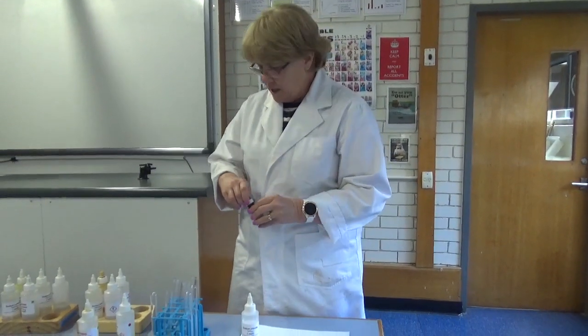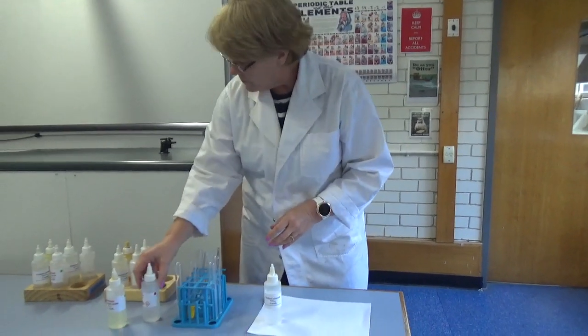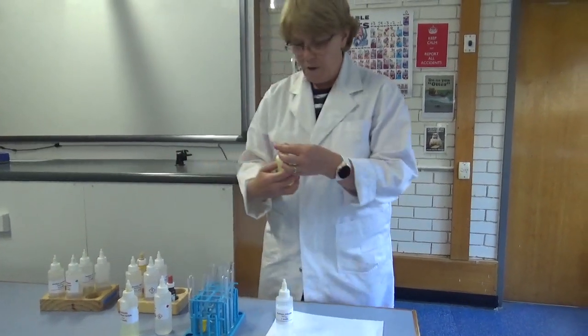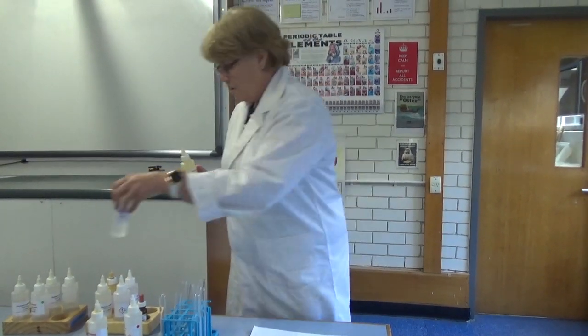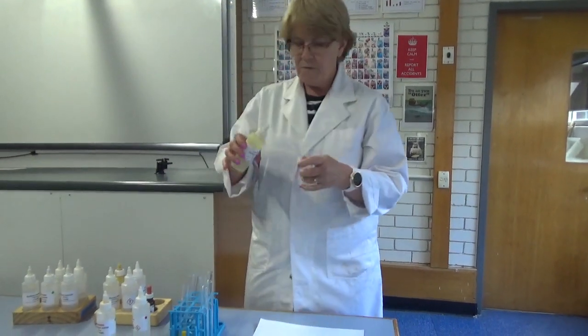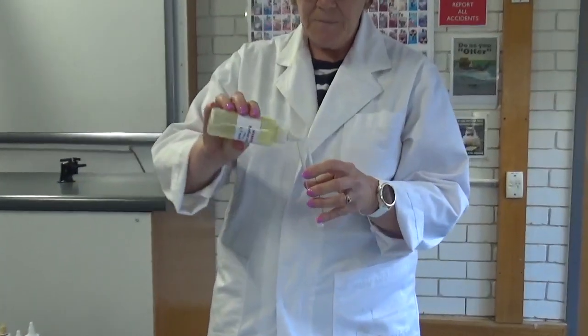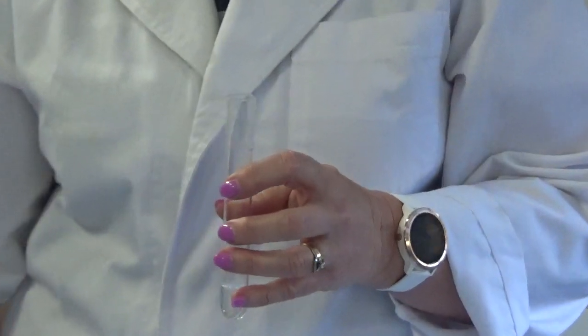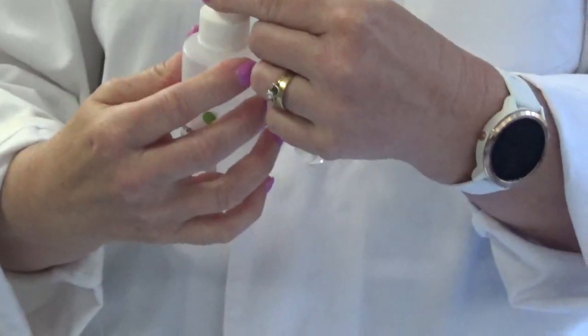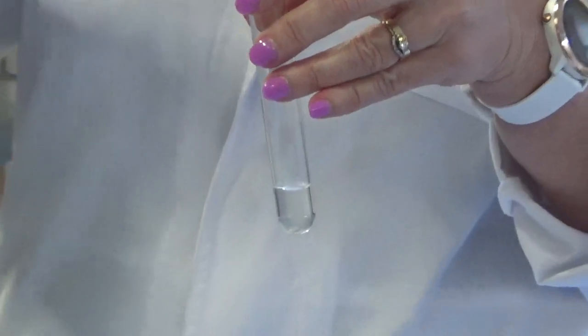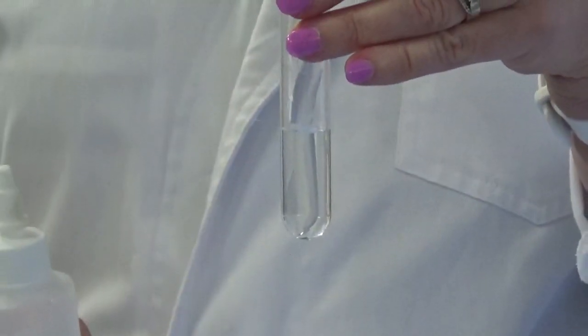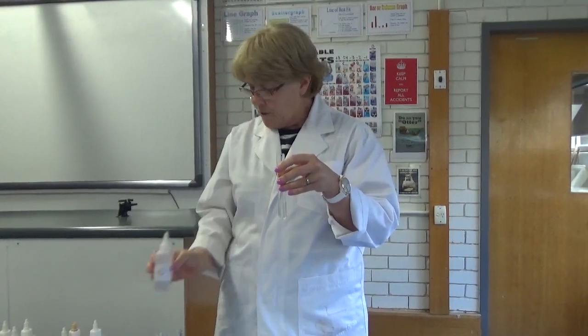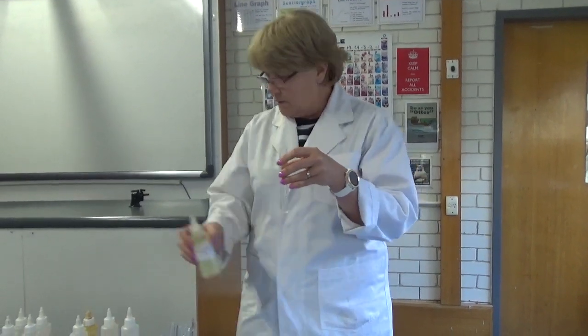Okay, let's try another one. So let's have some sodium iodide this time. And let's put that with some calcium nitrate. That's another one that doesn't do anything. But that's okay. Because chemical reactions don't happen for all of these.